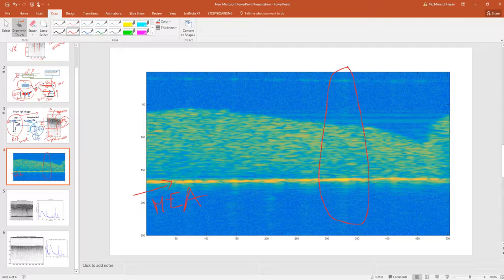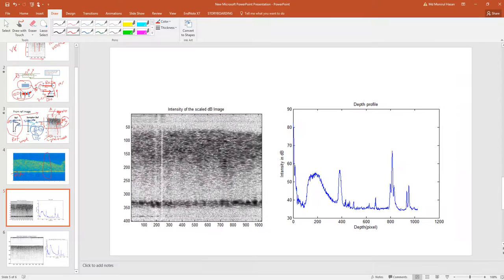As the multi-electrode array has electrodes, and the electrodes are very reflective, sometimes we see the back reflection from the electrodes, so we see the vertical streak in the image, something like that. Or if we look at another image like this, we can definitely see that there are vertical streaks. These are the vertical streaks in the image.